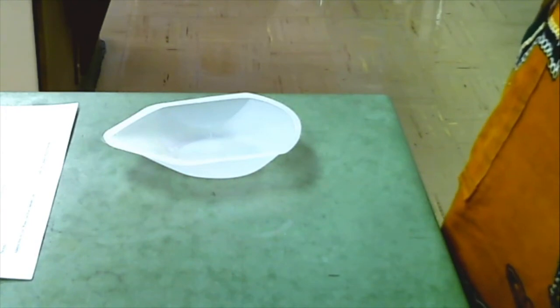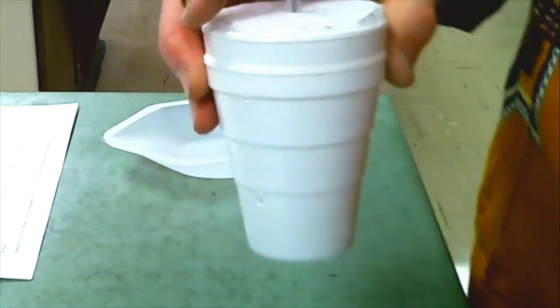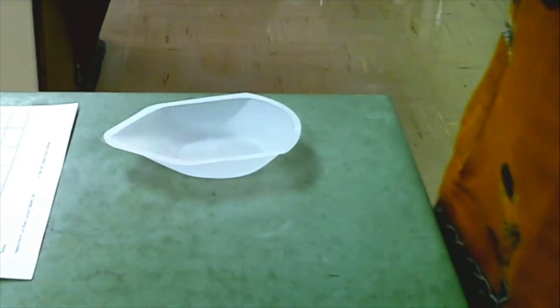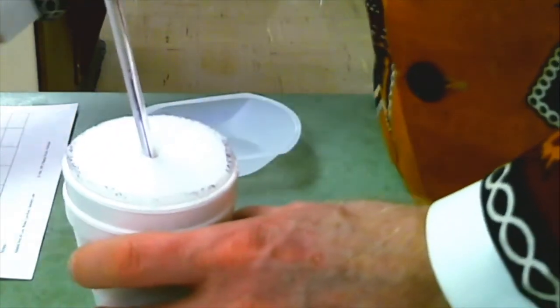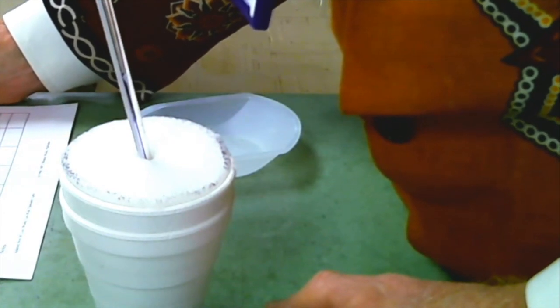It is at 17.8 Celsius, I will say. I still think that's 17.8. I'm going to make that the final temperature decision. 17.8 Celsius.